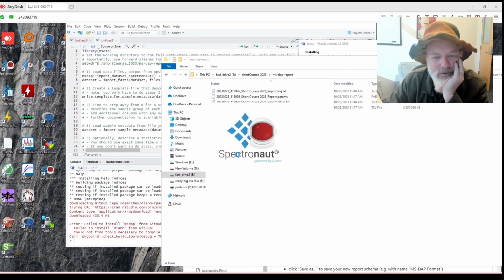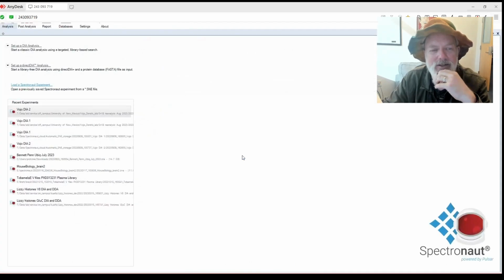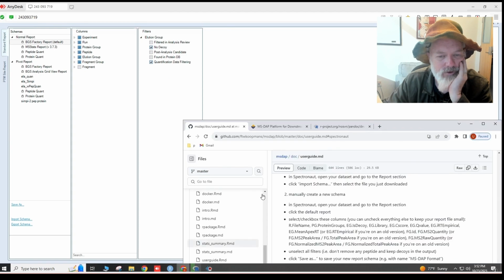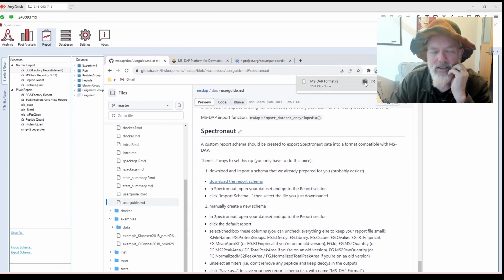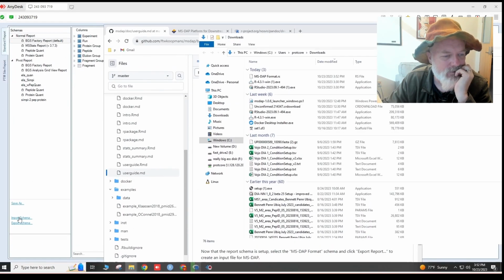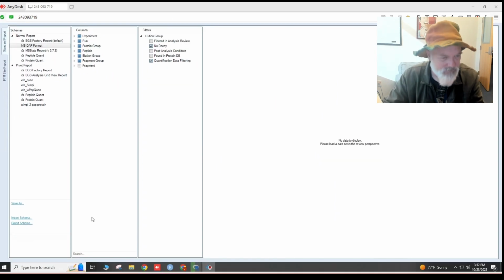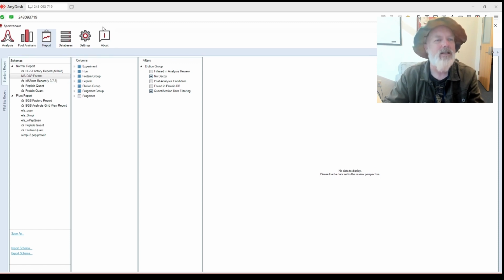Okay, let's see if my Spectronaut is updated, or if my viewer key is expired. All right, it looks like it's okay. So for report, basically you have these reports. And for MSDAP, it tells us we need to download the schema, which we did. It should be in downloads. Then we go import schema, and we give it the downloads and hit the format. And boom, there it is. Then when we output a report, we load our Spectronaut file. Once it's loaded, it'll give you an option to export report, and you select MSDAP format, and you are all set.